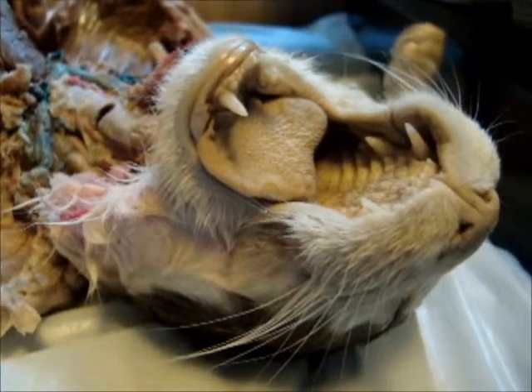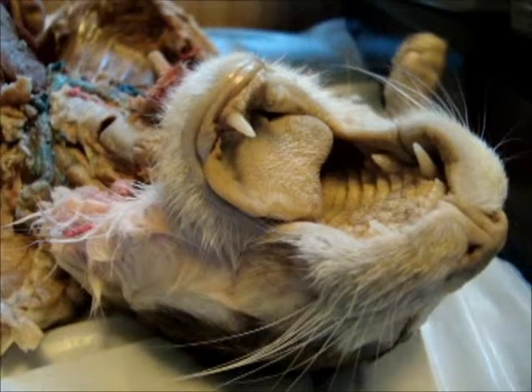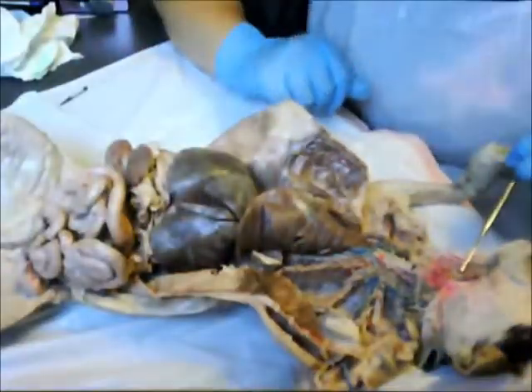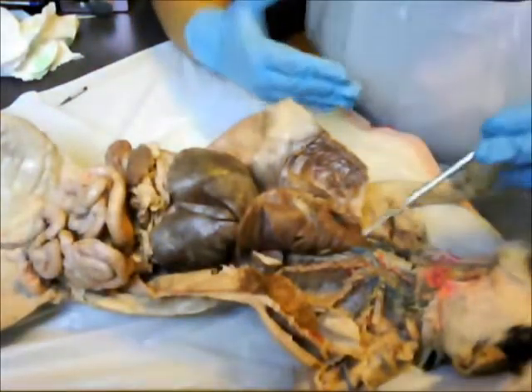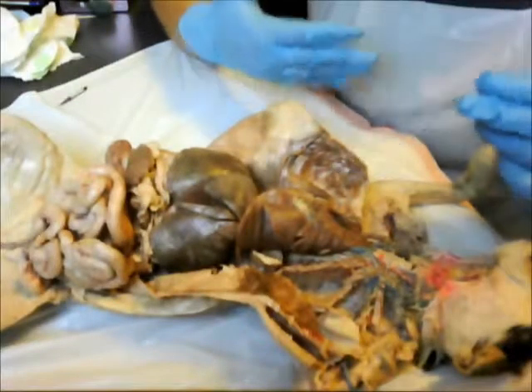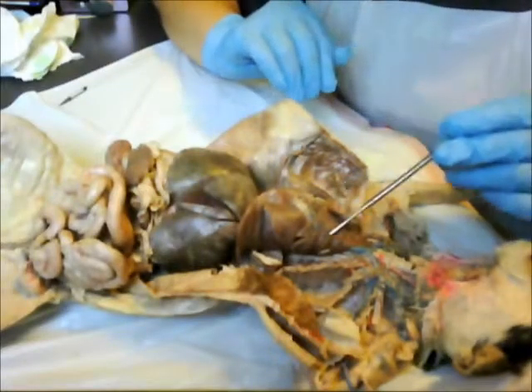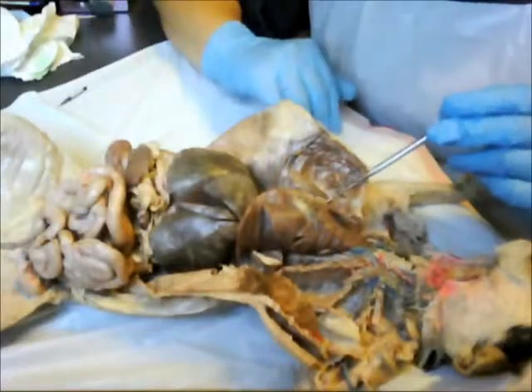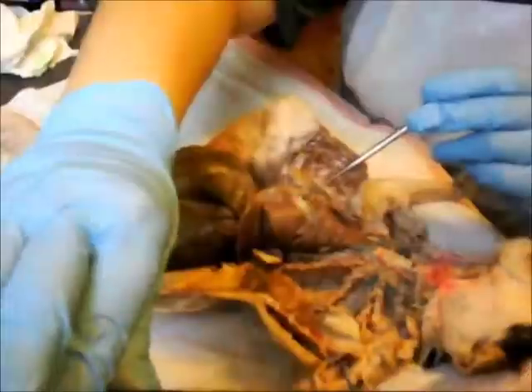And there's different sections of the pharynx known as the nasopharynx, oropharynx, and laryngopharynx. Okay, following the trachea downwards, this will lead you to the lungs. The human and the cat are very similar, however they're very different in anatomy as well, because the human lung has 2 lobes on the left side and 3 lobes located on the right. However, the cat has many different lobes.